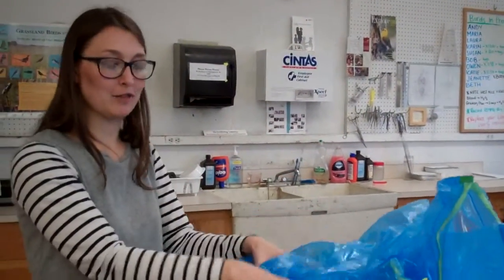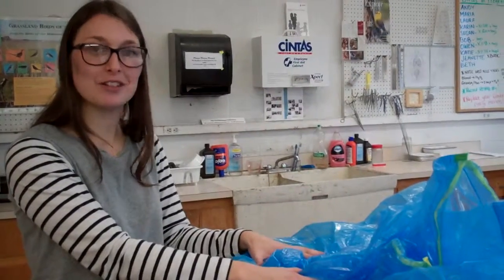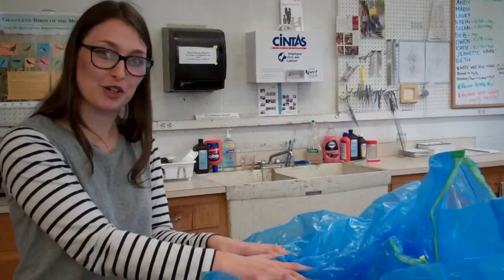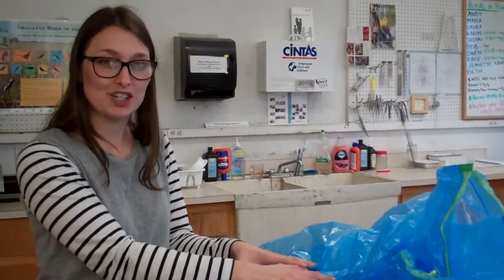This creates an environment that no insect or insect eggs can survive, ensuring that only our specimens are going to the collection and not any hitchhiker pests.